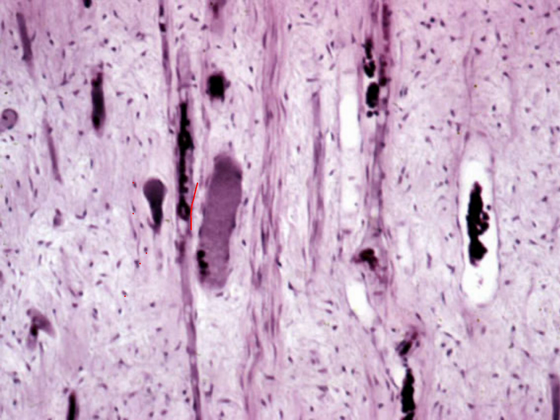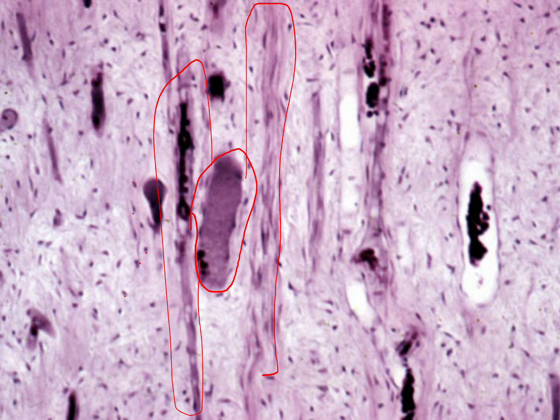And if we take a look at this structure, it's woven light and dark violet. Same here. So these all are nerve bundles. This one has blood vessels inside, as you can see, blood cells inside. And it's thin-walled, so it's a venule. This is a nerve fiber. All structures that have woven light and dark violet and look like woven wool are nerve tissue. They don't have an empty lumen.